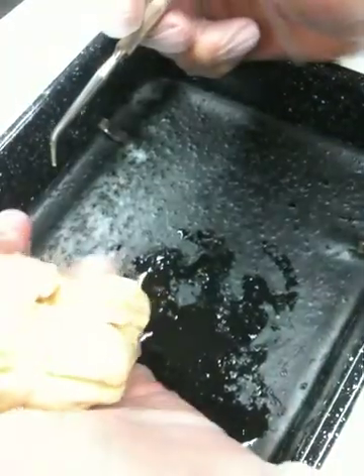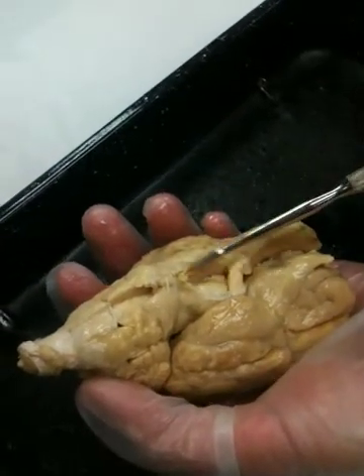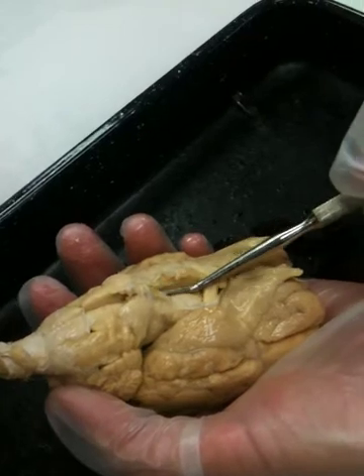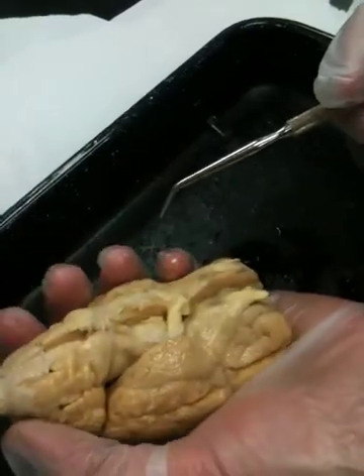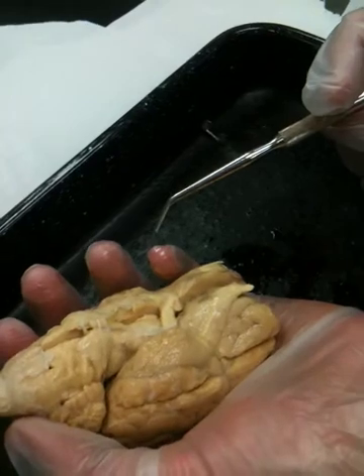In order to see the cranial nerves, which is going to be our next step, we're going to have to remove this entire piece of this membrane along with the pituitary gland. If you want to see it, go to that table so that we can get down and look at those. This heart-shaped structure right here is the membrane. If you haven't done that already, you'll need to do that. But you'll need to be very careful in the way that you remove this membrane to preserve any small white fibers you can possibly see on this brain.